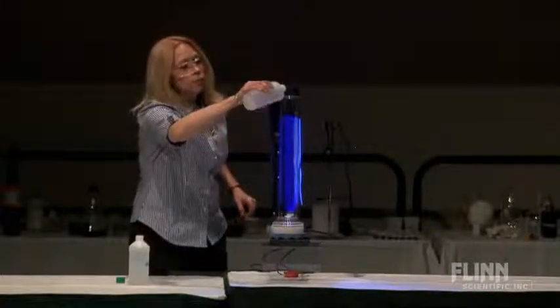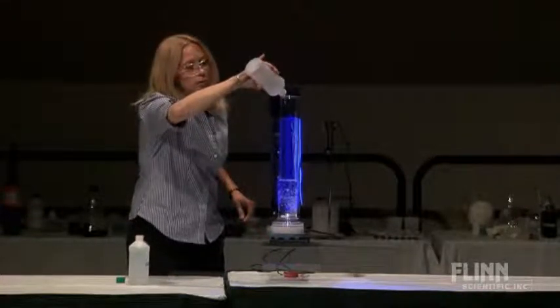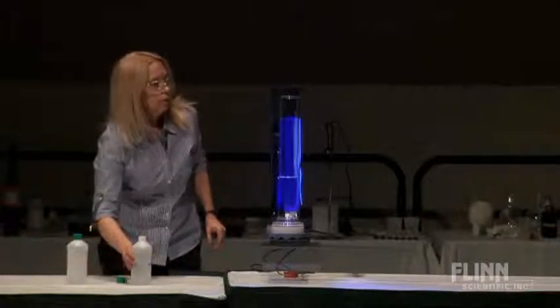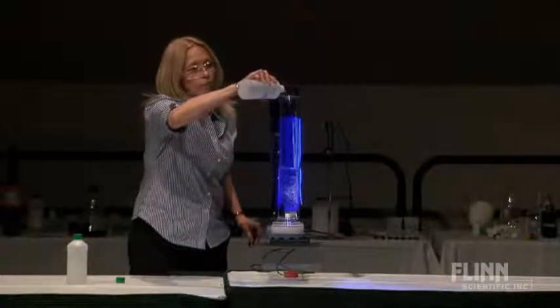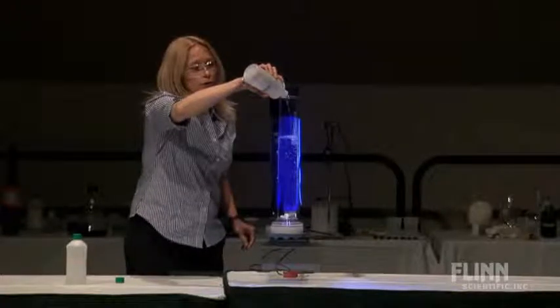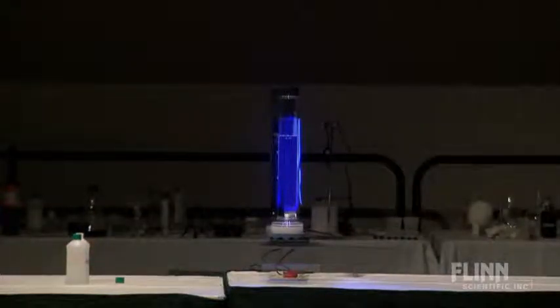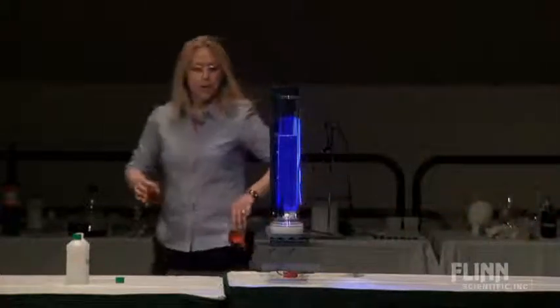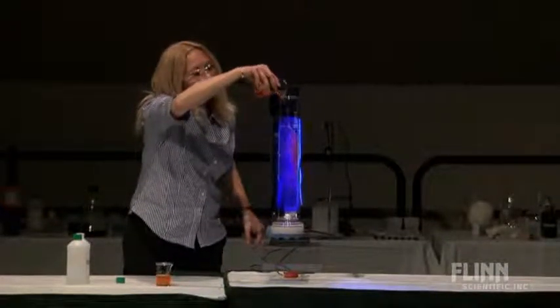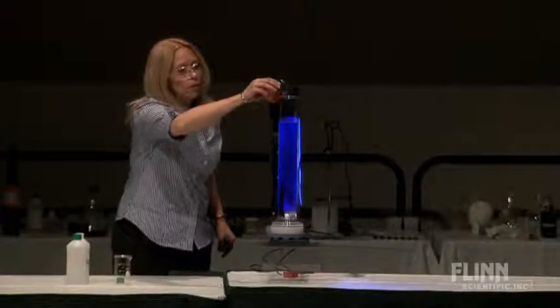Here's what it looked like once Amy got it mixed up — Solution A. I cannot do this reaction justice in this short of time, but I'll show you why. It's an A and B clock reaction. If you know me, you know that my least favorite element is bromine — it has attacked me a couple of times due to my own stupidity; it ended up in my mouth one time at 16, which was really stupid. Do we have some oscillating going on? Yep.